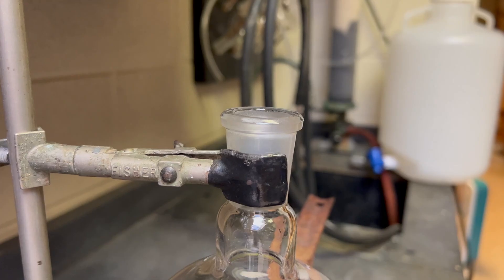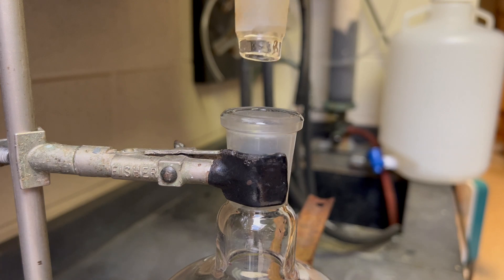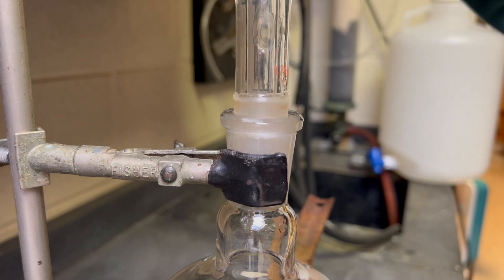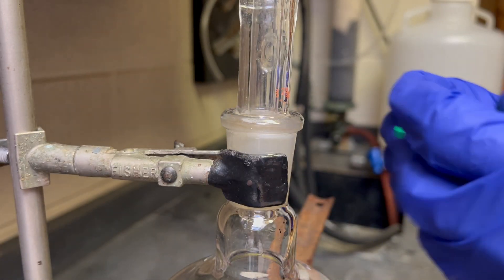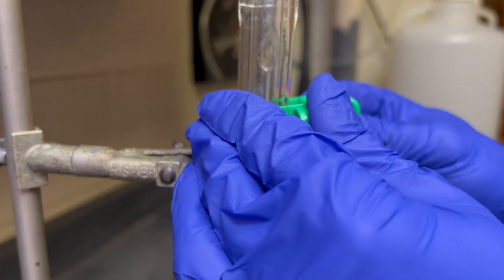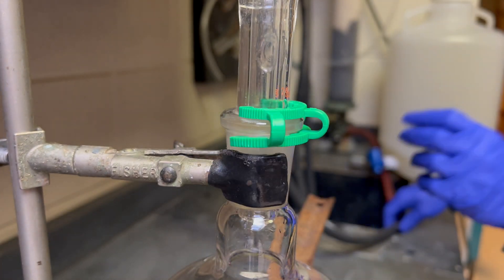Once all the chemicals are added to the reaction vessel, a condenser is connected. Then it is plumbed in and water is passed through it.